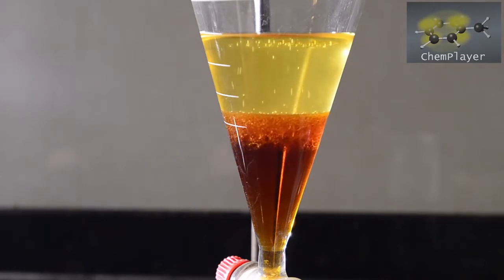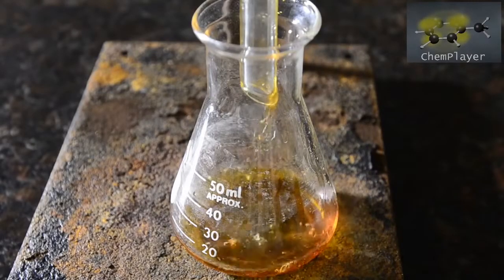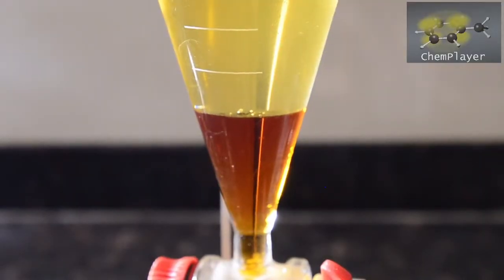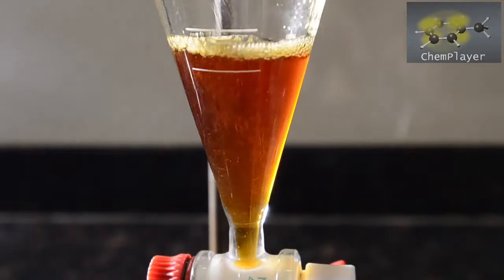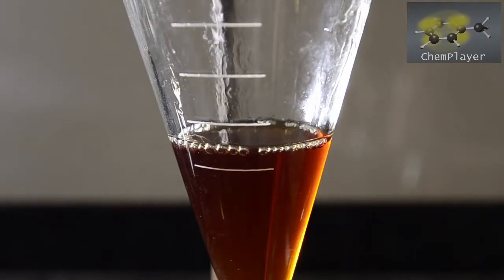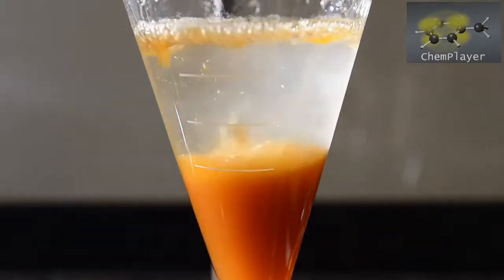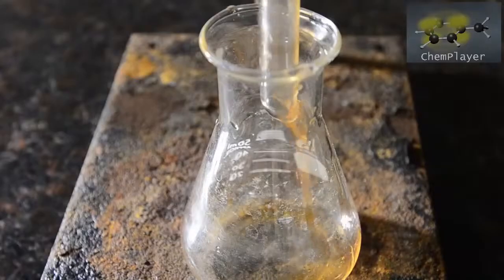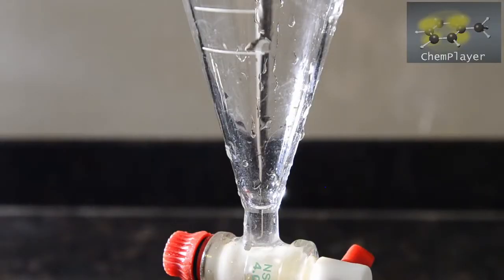Once separated, we drained off the bottom organic layer. We then discarded the aqueous top layer and returned the organic product back to the funnel for a second wash. Again shook thoroughly and then separated off the bottom layer. We returned this to a clean funnel once again.